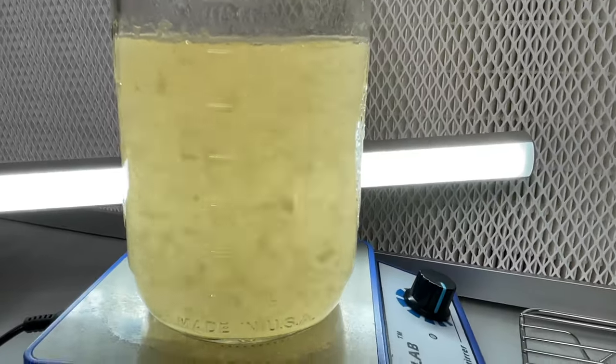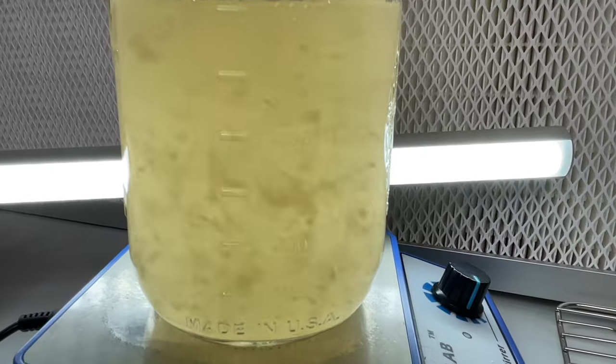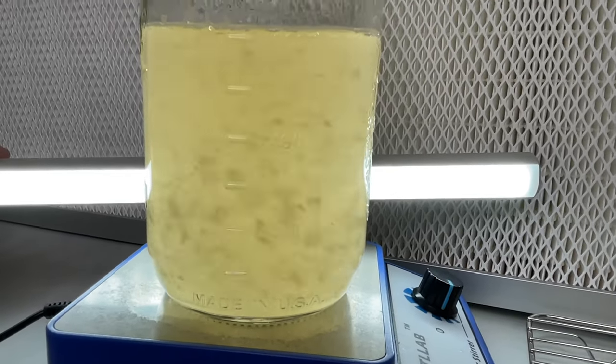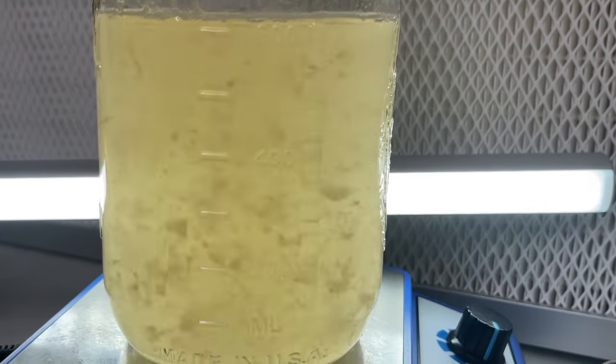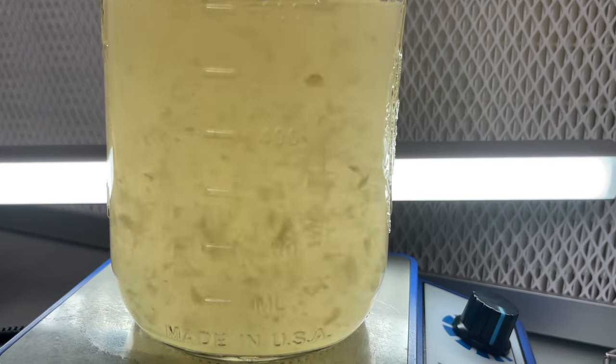I'm pretty happy with the results as I'll be able to make syringes with this liquid culture now, but always make sure to test them on agar plates and make sure that they're clean.